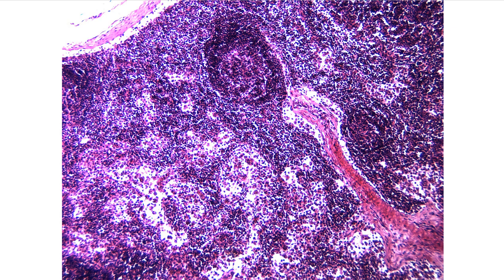So another thing that we need to find in this structure would be the trabeculae. When I'm looking for trabeculae, I'm looking for an obvious difference in color, of course. The trabeculae, to me, always seems a little bit more dense and resembles a tissue, or tissue-like appearance. I don't even know if that's an accurate description, but that's what I'm going to describe it as.